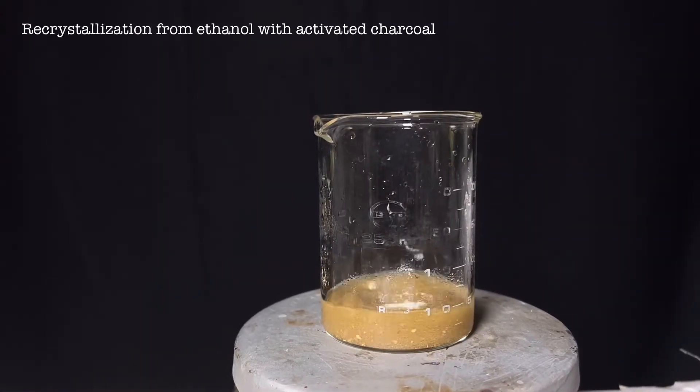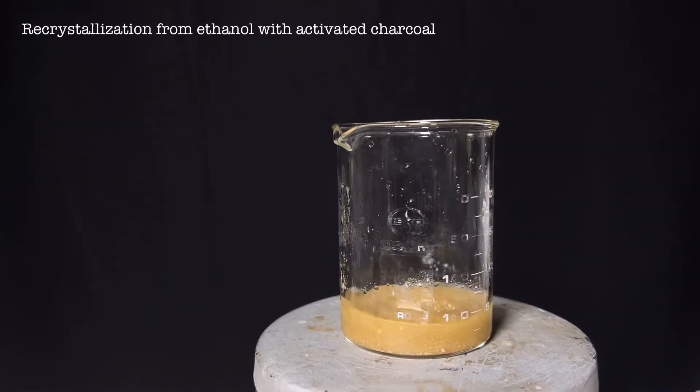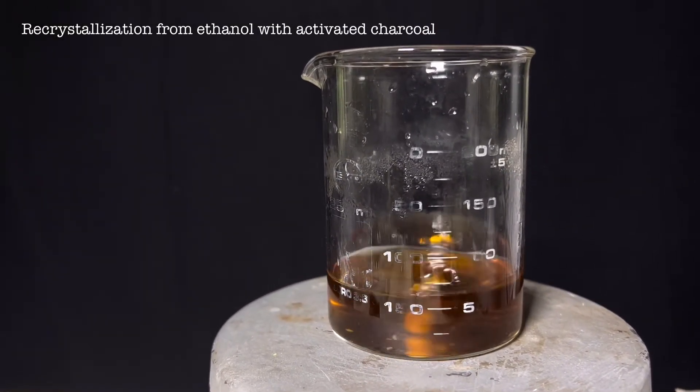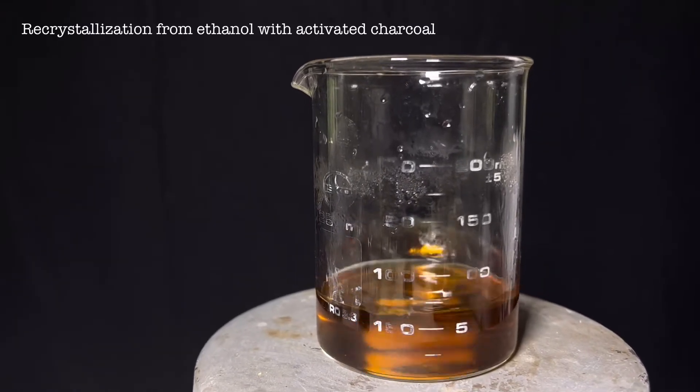The crude product was then recrystallized using 96% ethanol. Minimal amount of ethanol was taken and the crude product was dissolved in it by heating the solution.